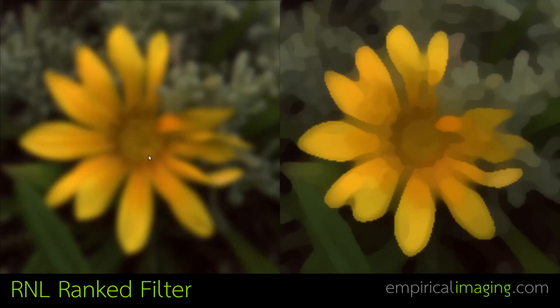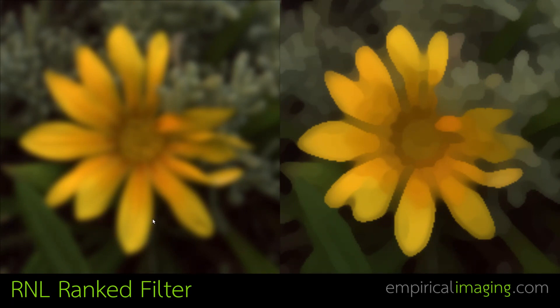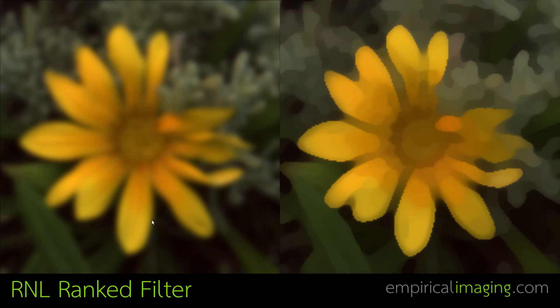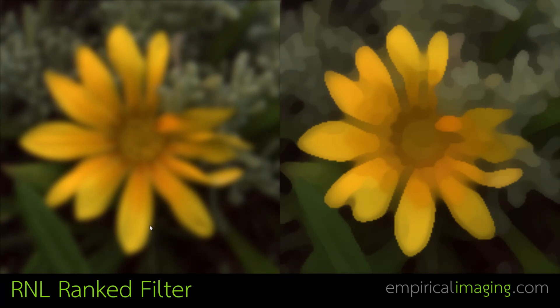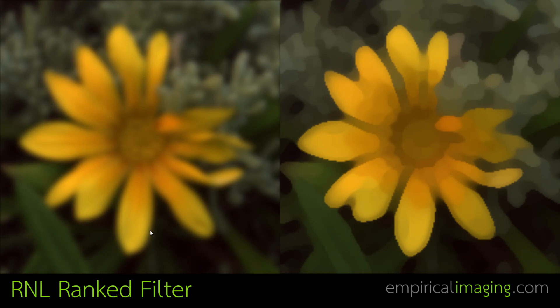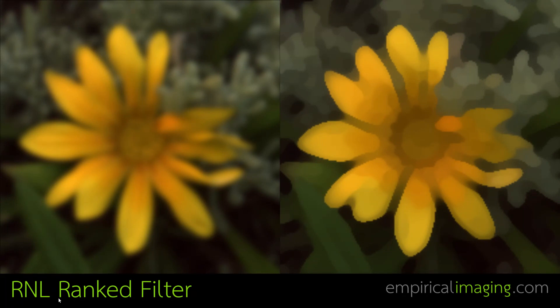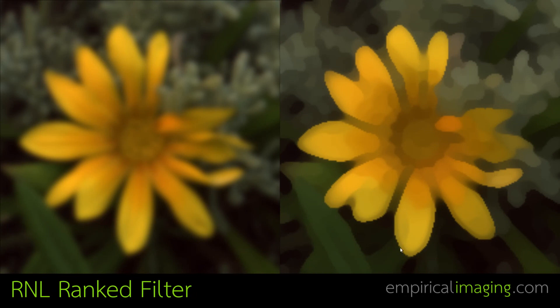The acuity control creates a blurred image. Although it has stripped away the spatial information that wouldn't be visible to the receiver, it has created these blurred edges — and this is not what a given visual system would be perceiving; it would perceive the petal as having a sharp edge against its background. These intermediate pixel values created on edges are also highly problematic for investigating the intensity of boundaries or clustering. So we've developed a method for reconstructing sharp edges and reducing noise called the RnL Ranked Filter. RnL stands for Receptor Noise Limited, which is the perceptually uniform colour space used throughout the entire QCPA framework and has been well tested in a range of animals.